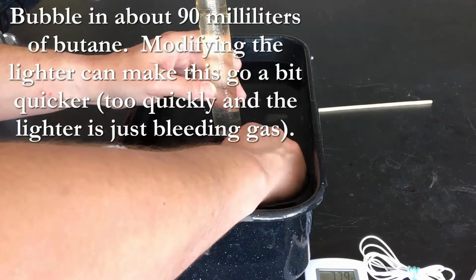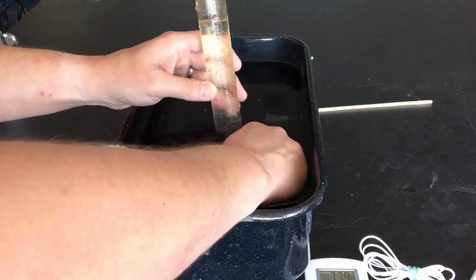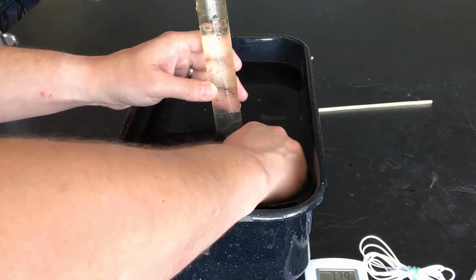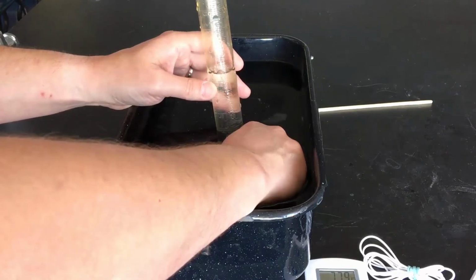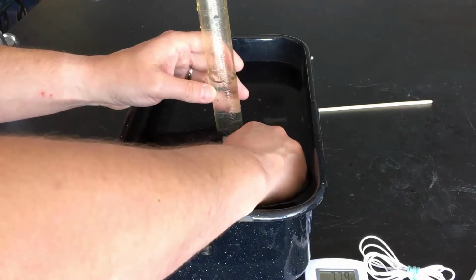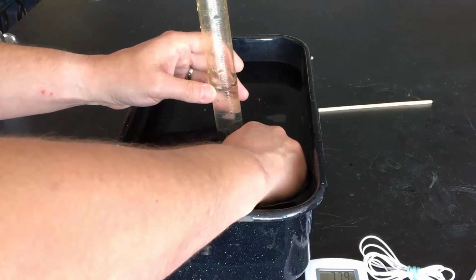Now, when you modify your lighter, you'll use the little plus minus switch that's on there. If you pop off the little metal safety bracket, that little switch is actually a small plastic wrench. You can drag it to the plus side, lift it off, drag it back to the negative side, let it set down, drag it across again, and you can do that a few times, allowing it to have a tremendously large flame.